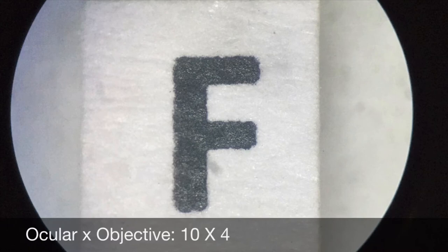Now, draw the letter F as you see under the stereoscope in the lab report in the stereoscope column and record the magnification.